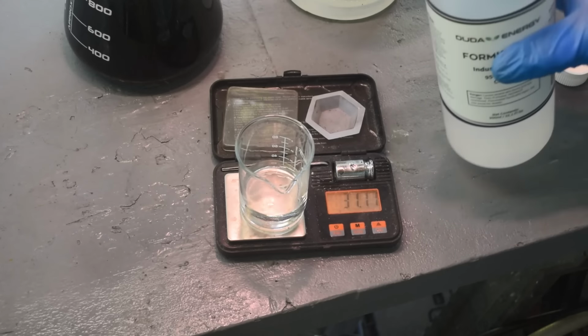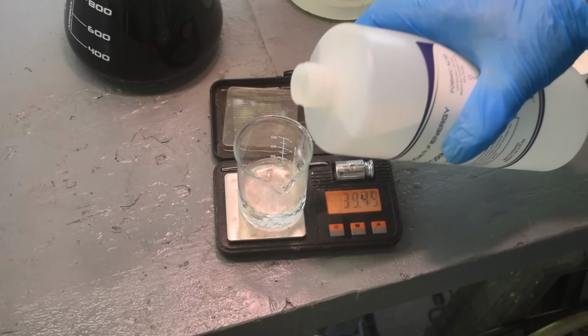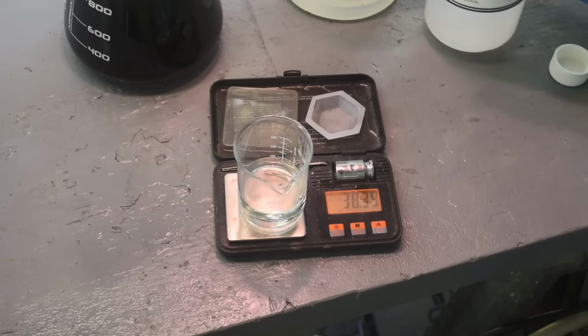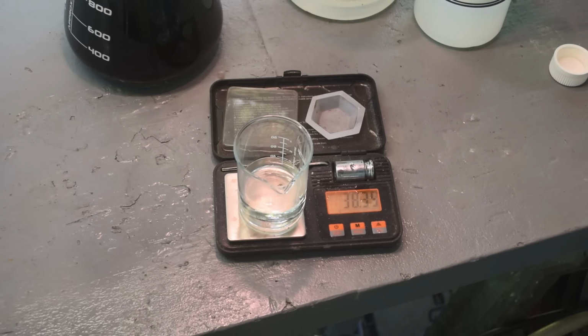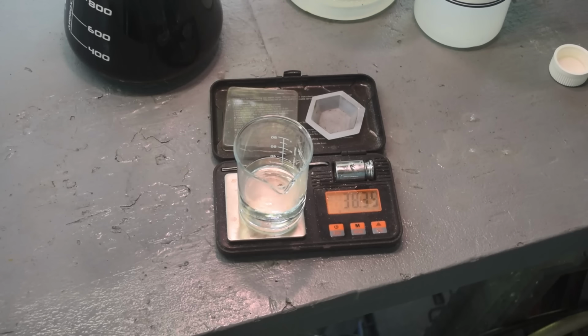Uh-oh, I am spilling it all over the place, and that is not good. I'm gonna have to clean up my scale. 38.35, that's good. I'm gonna stop there and clean up my scale real quick before it starts dissolving the scale.